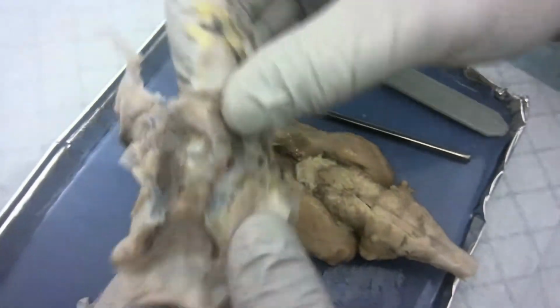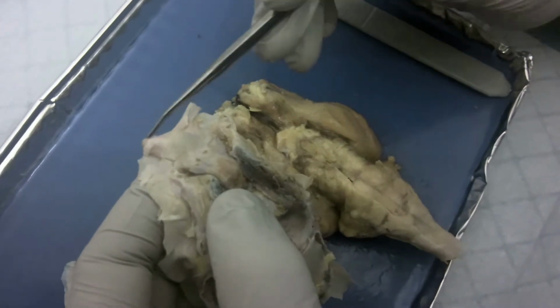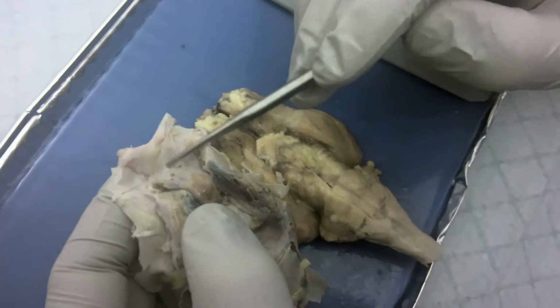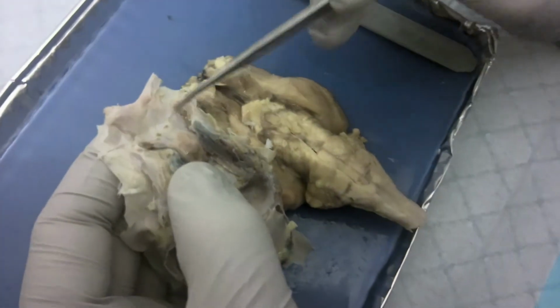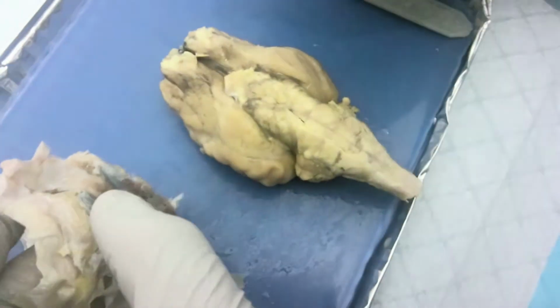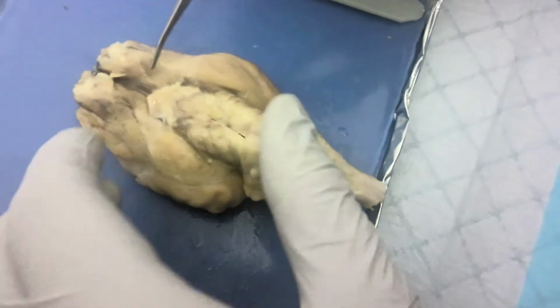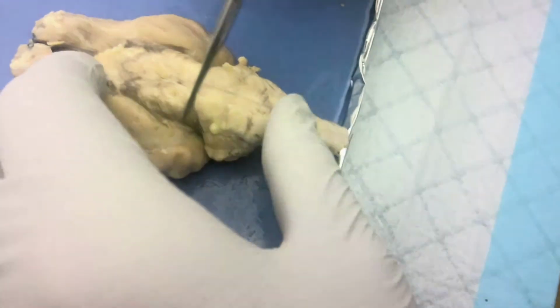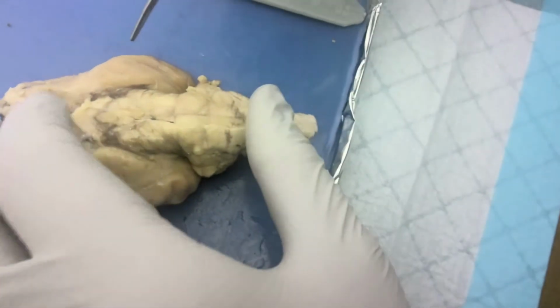You can see this little Y-shaped, let me grab the pointer here. This Y-shaped structure, although it's a little bit obscured from the meninges, that's the optic nerve, and where they cross here would be the optic chiasm, and then they would cross to the opposite sides of the brain along the optic tract here. The oculomotor is about right here. The trochlear is about here. The trigeminal nerves would be just underneath that, and then lastly the abducens would be somewhere below that.